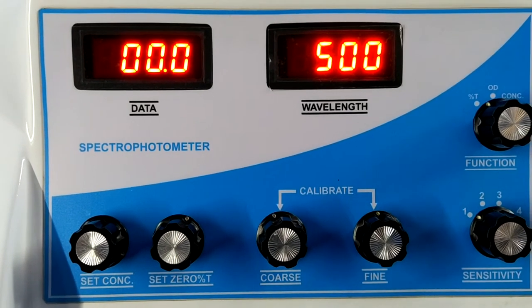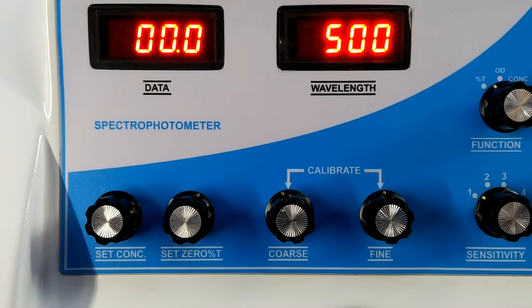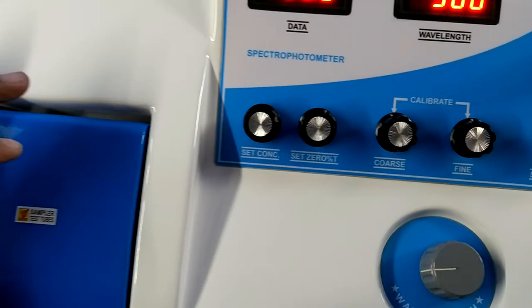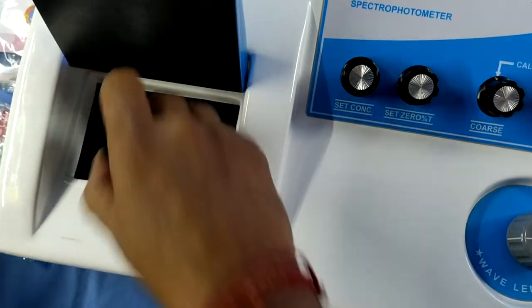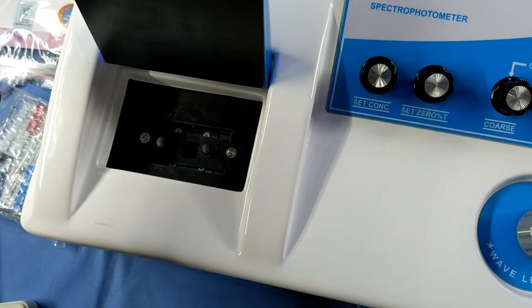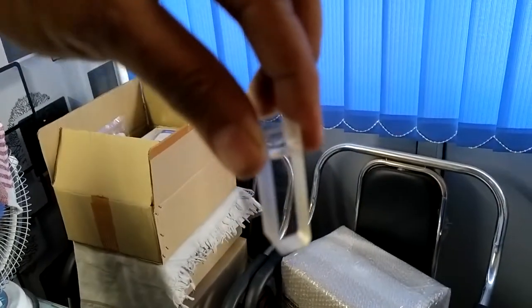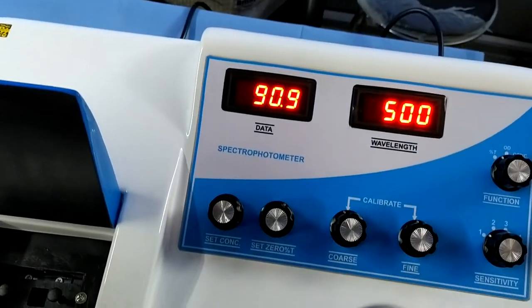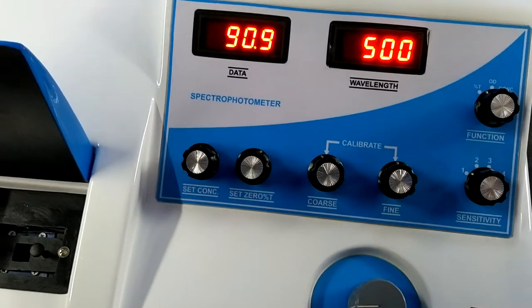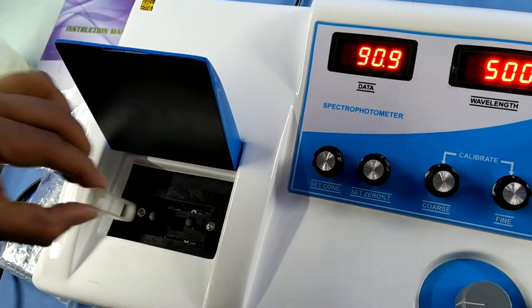This is the preset zero on 500nm. Now I am placing the blank into the jack. I am using distilled water as a blank. This is the glass cuvette — two sides are opaque and two sides are visible. Your beam is passing on this way, so I am placing the visible side to the jack.